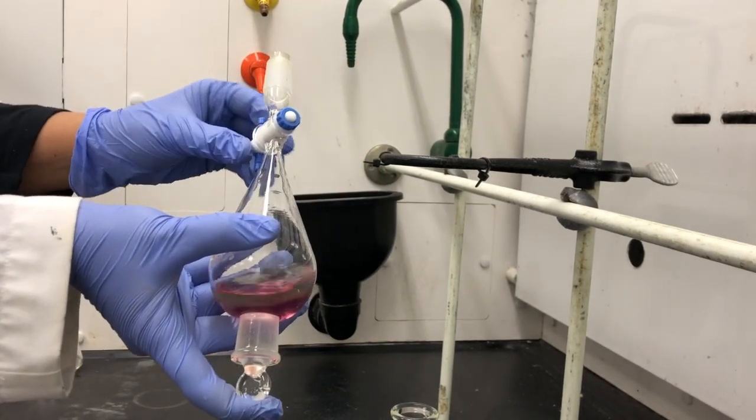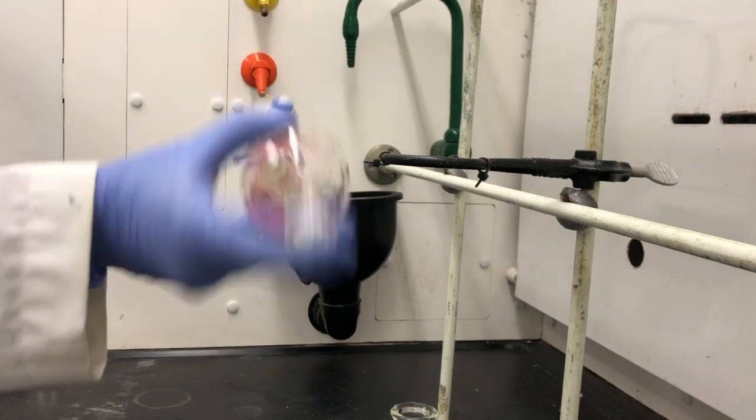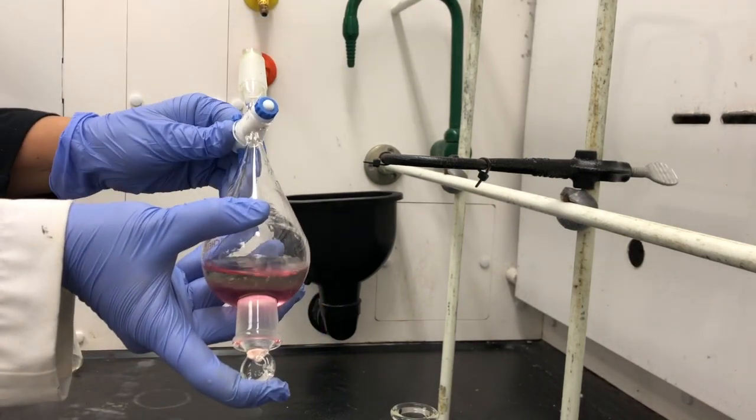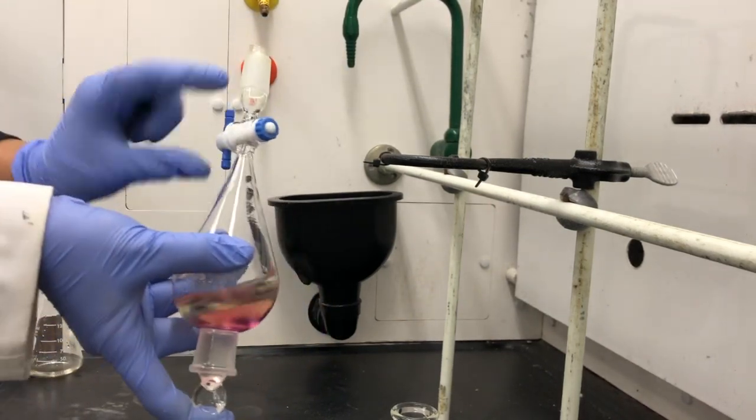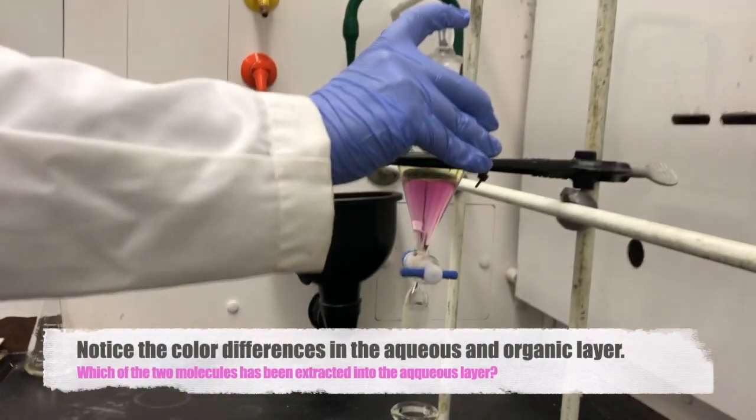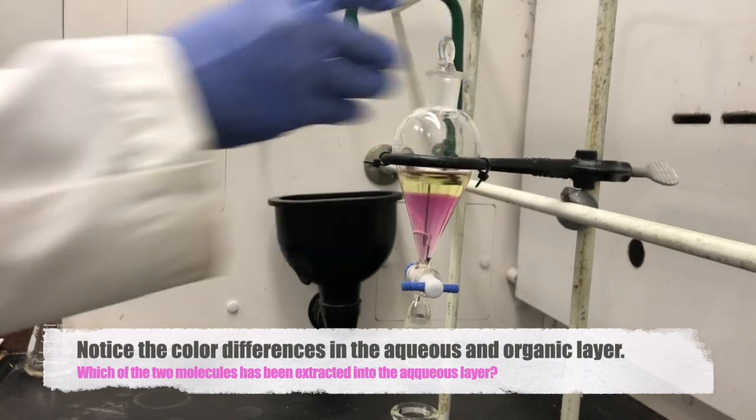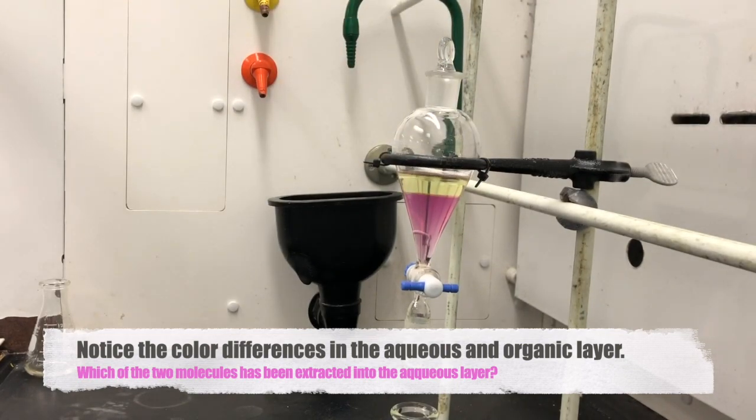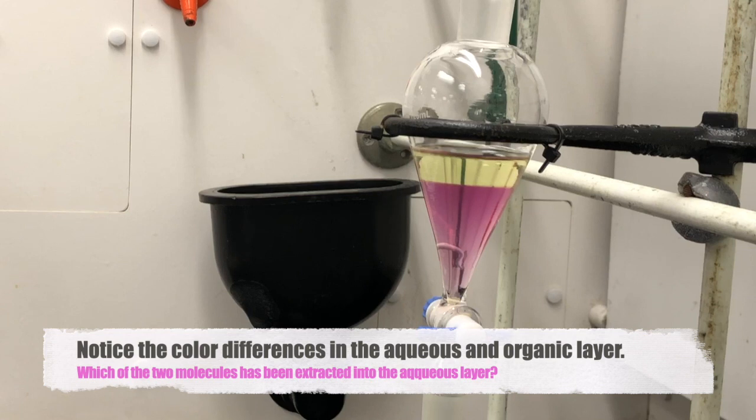All right, and then make sure you close it back, and you can place it right back in here and keep this stopper on. And give it a minute for the layers to separate.